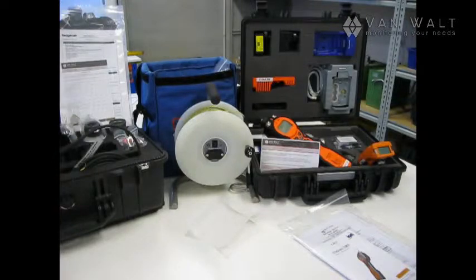So now what we're going to do is set some of this equipment up and have a look at how we would use our peristaltic pump in a low flow sampling situation.